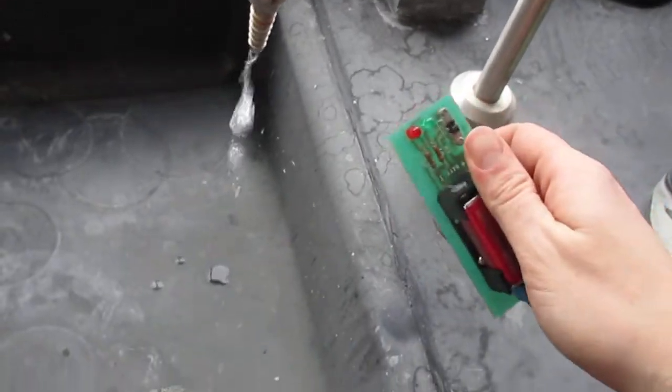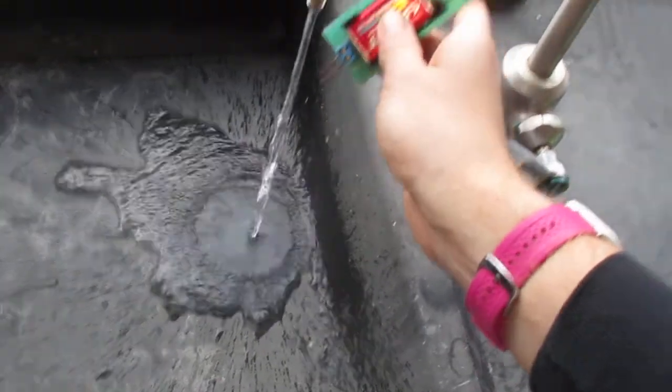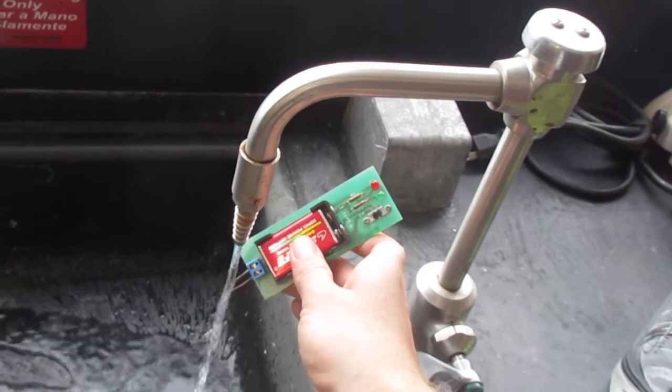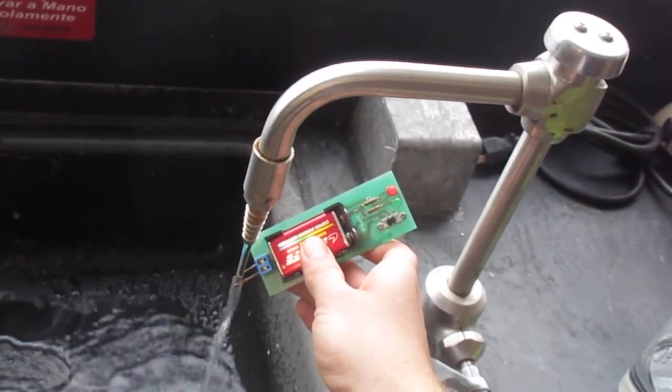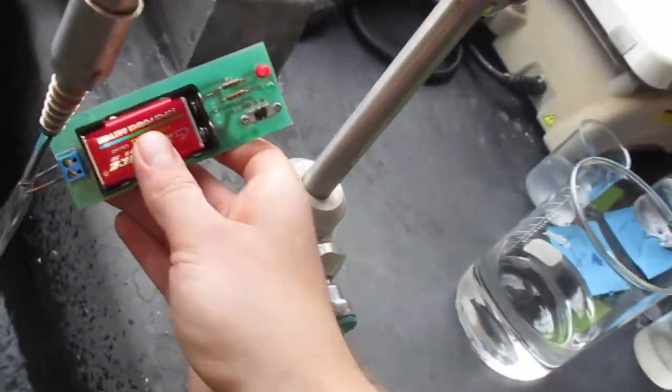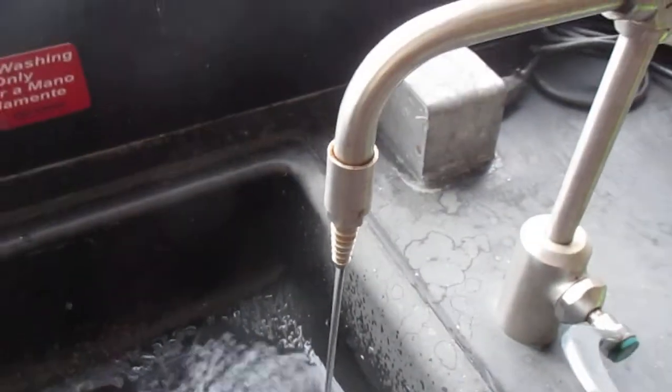If I ran tap water—I have gotten it to work like this before so we shall see. The red light is blinking. I'm going to change the camera so you can see that a little bit better.